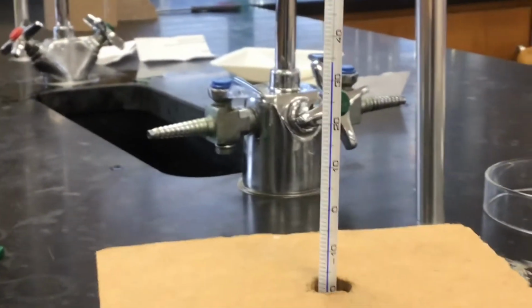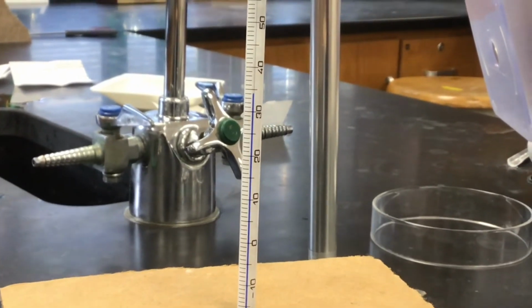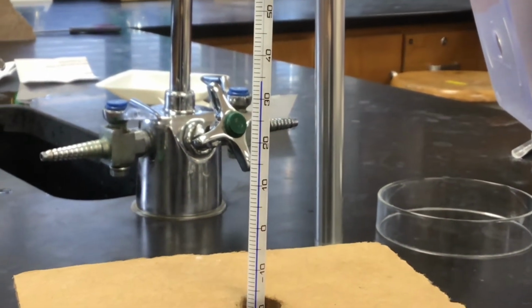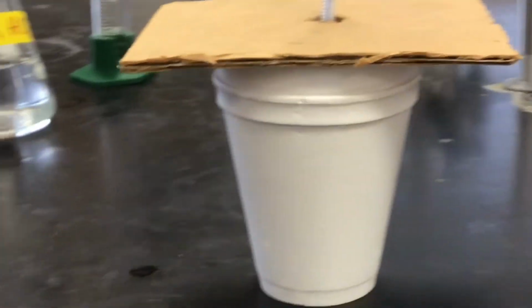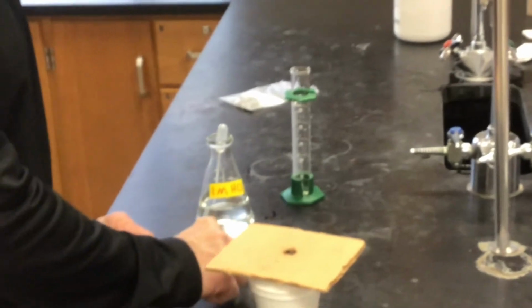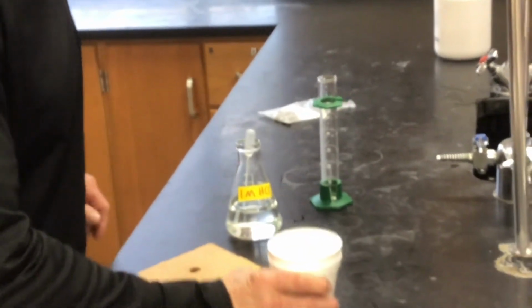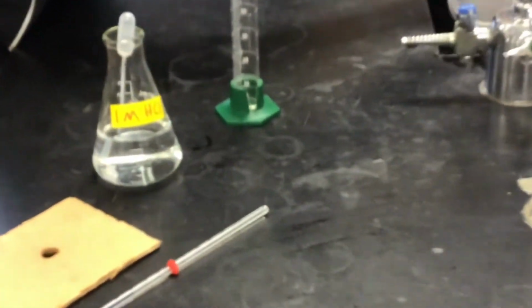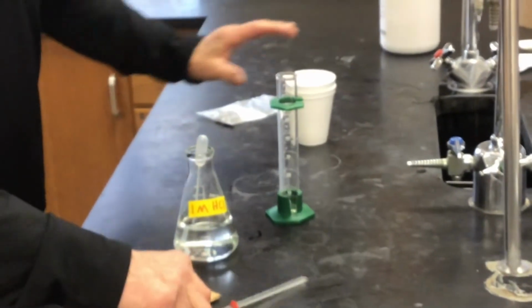Just slide over here. Okay, so there's our final temperature of the acid with magnesium. But let's go ahead and take that thermometer out of there and let it cool off, and we'll get the initial temperature, which we didn't get the first time. The acid has come out of this flask, so all of the acid initial measurements should be the same. Yeah, you would think so. Is it okay if I just stick it in here? Stick it right in there, that's fine. That's actually nice because it'll sit up nicely.